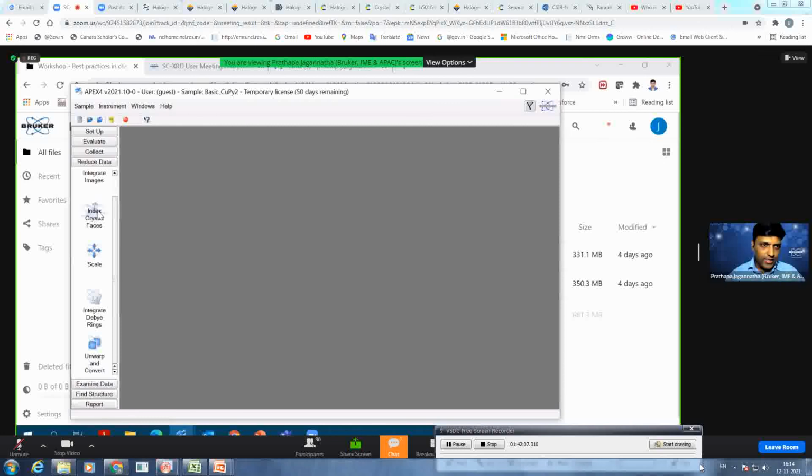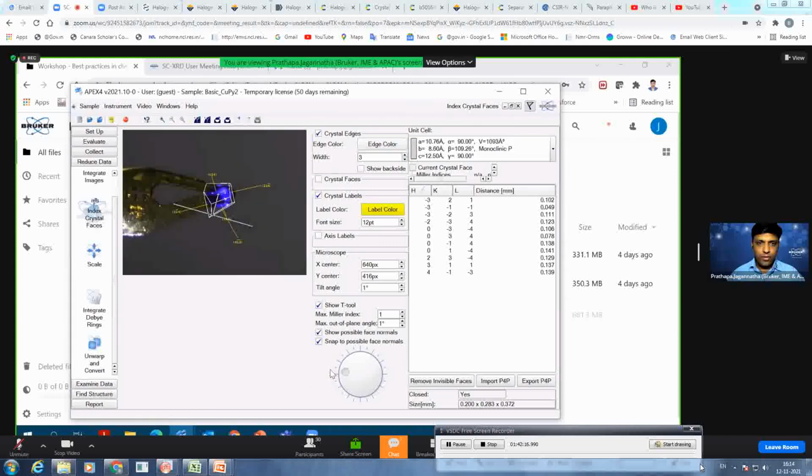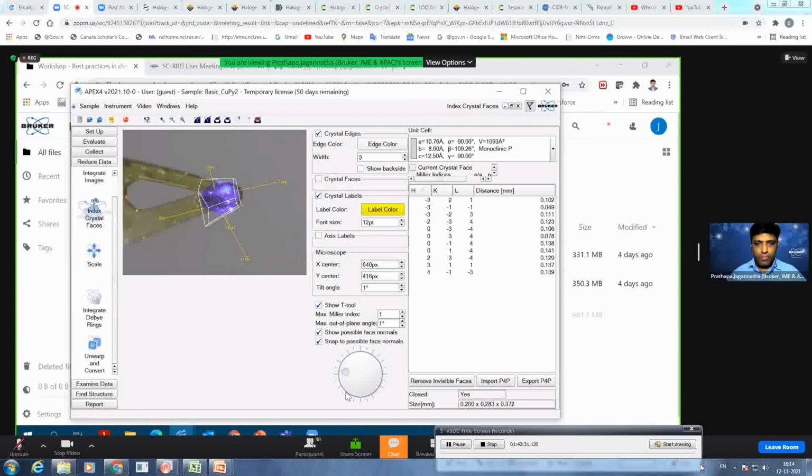Reduce data, index crystal faces. Okay, so at least the advantage here, which I have shown in the best practice method, is that you get this adjustment and zoom in and zoom out option as well. Now you can look carefully at your crystal for better face indexing, and you can also do this contrast brightness adjustment to have a better look at your crystal, and then you can index your crystal faces however you wish. But of course, I just show it for practice.